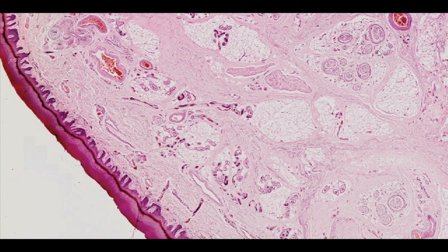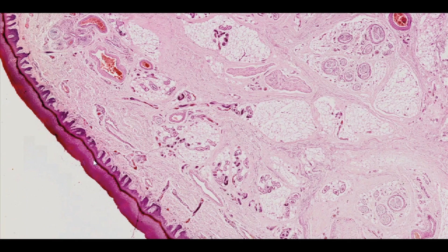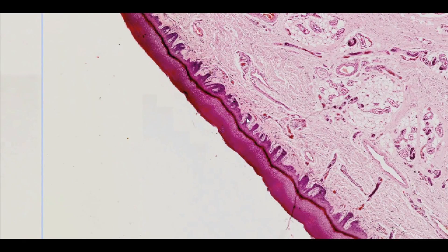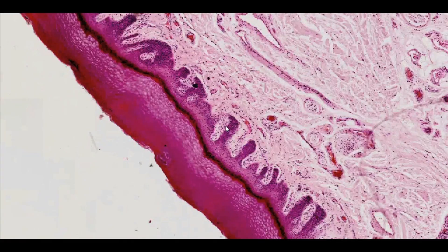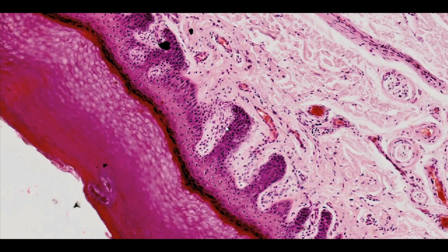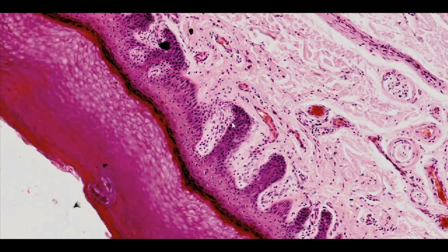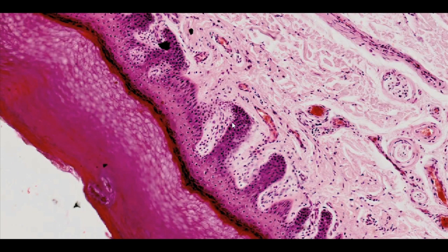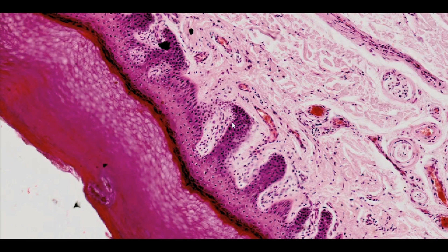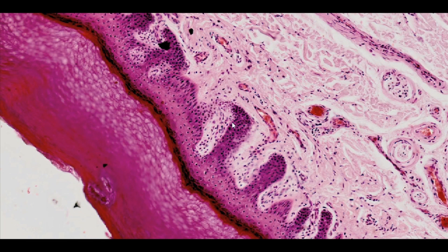The epidermis is a stratified squamous keratinizing epithelium. It consists of several types of cells: keratinocytes, which are the primary cells of the epidermis, melanocytes, immune cells, and Merkel cells.